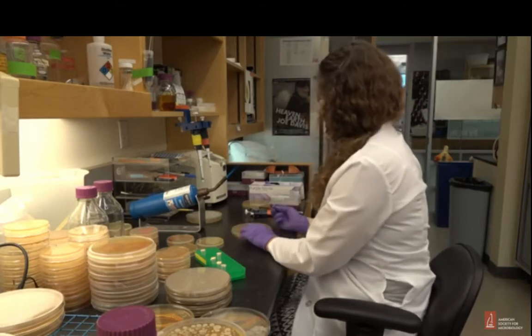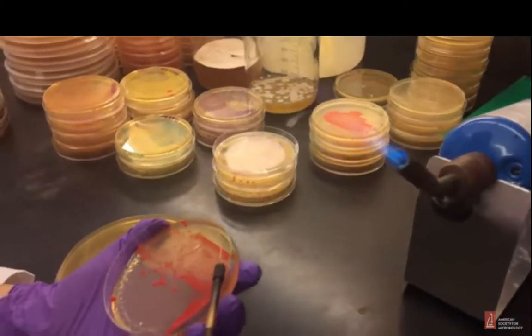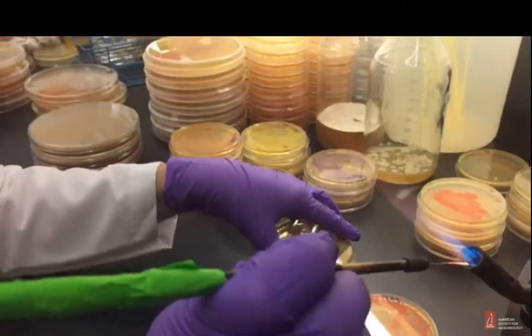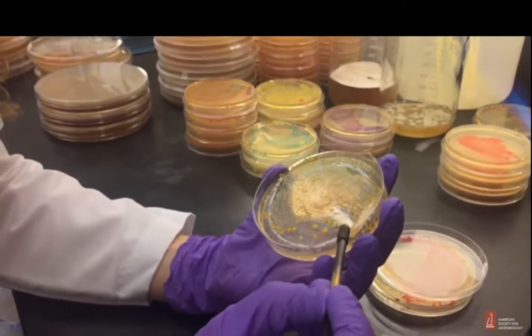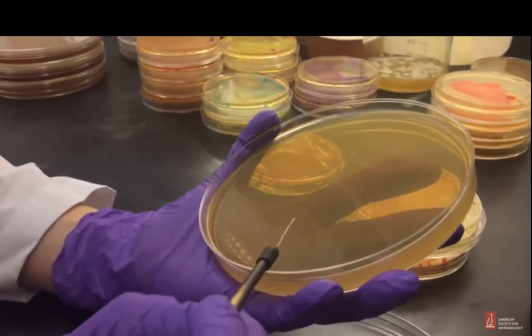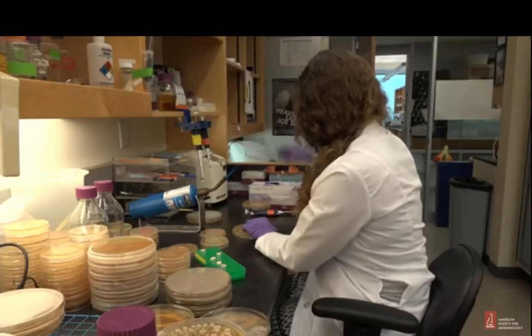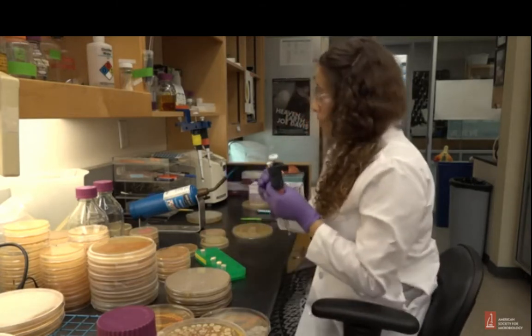Now she's using a burner, which is a much hotter flame. Sterilizing my loop. Wow. Cool the loop. Take a little bit of bacteria. And I'm gonna draw this stem. Sterilize again. For the leaves, I'm gonna use the medium loop. Oh, you see what she did? She cooled it off on the side. And for the flowers, I'm gonna use a different technique with a pipette. So I have the bacteria here in rich media.